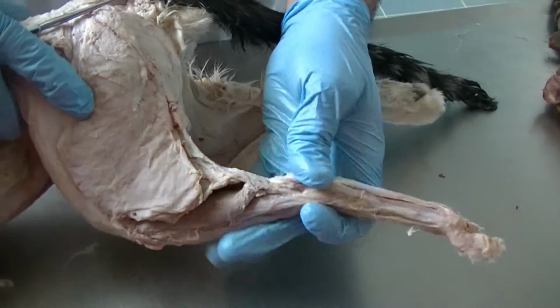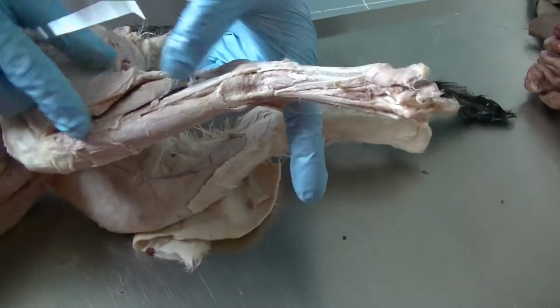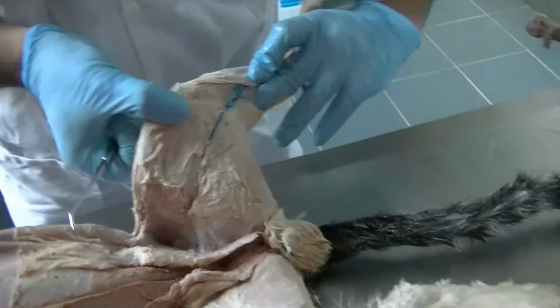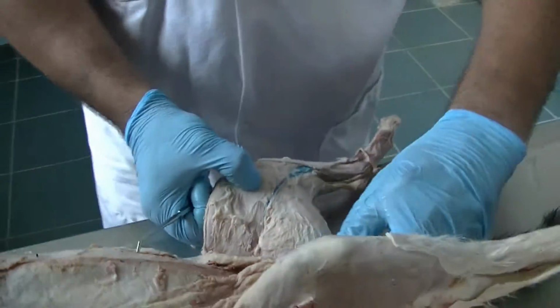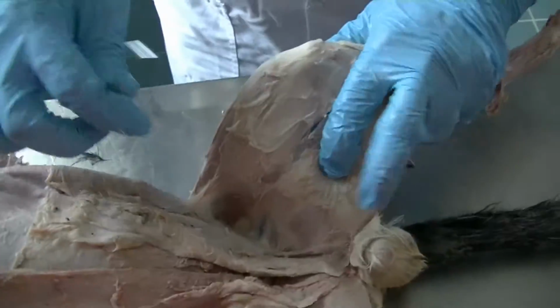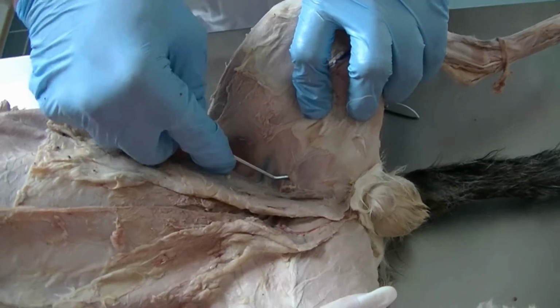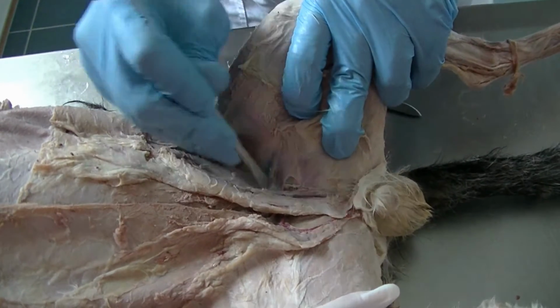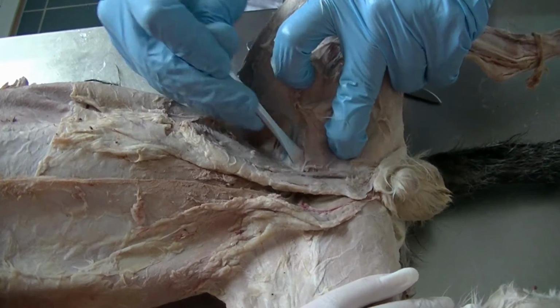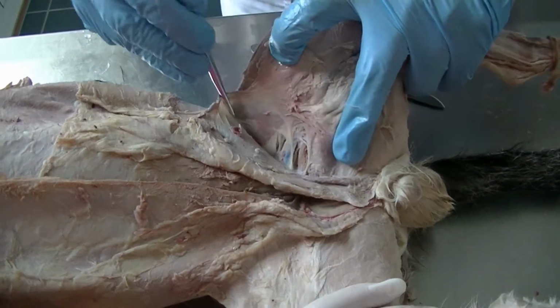Now here we look at some of the flexors of the digit and tarsus in the hind limb. We saw the lateral head of the gastrocnemius, the soleus muscle. As we go to the medial aspect, we are going to observe the same structures: all the muscles which are responsible for adduction of the hind limb are present, including your gracilis, adductor, pectineus. Pectineus is much smaller in the cat as compared to the dog. The pectineus muscle, then the femoral triangle.